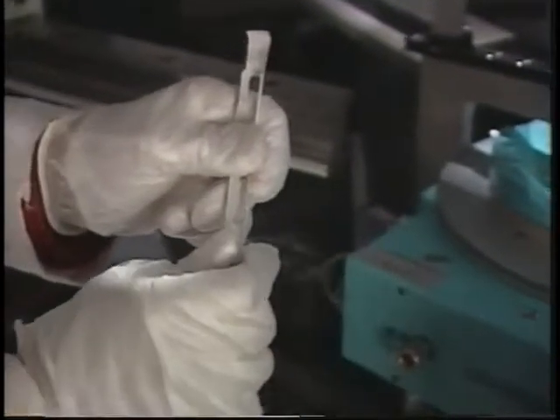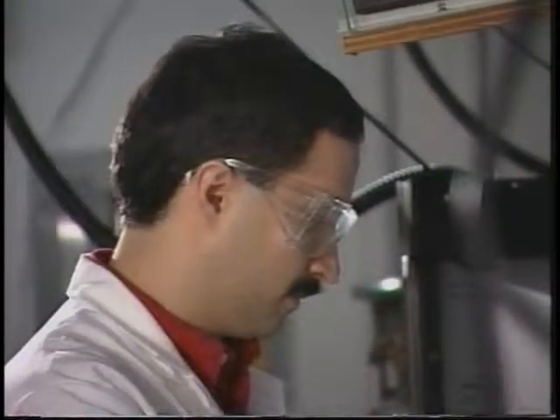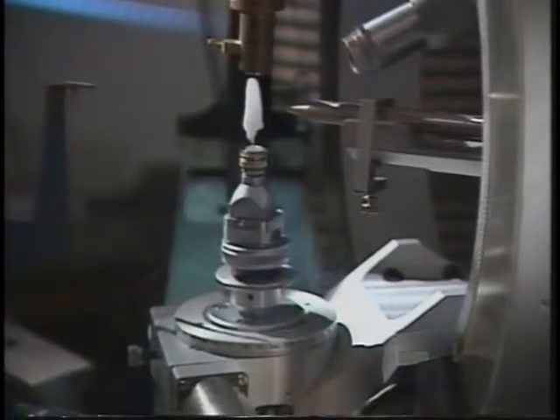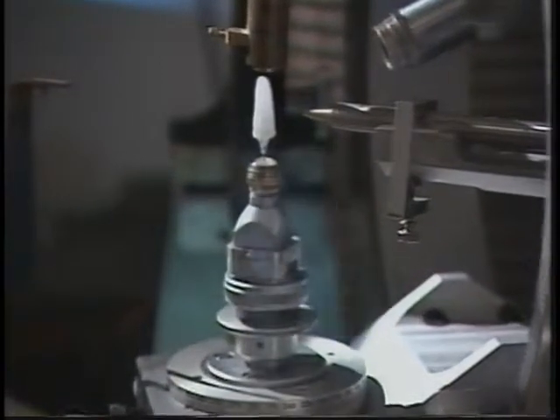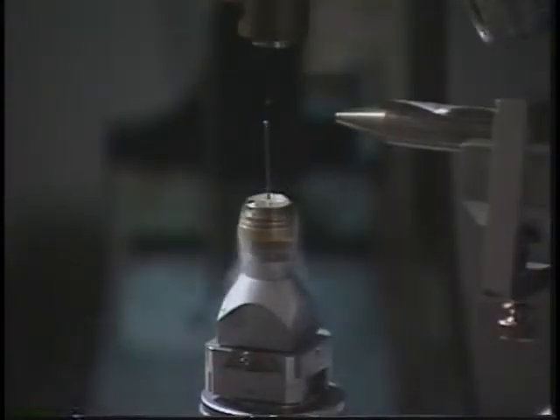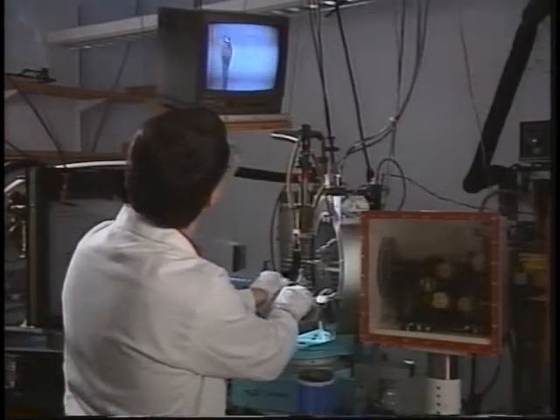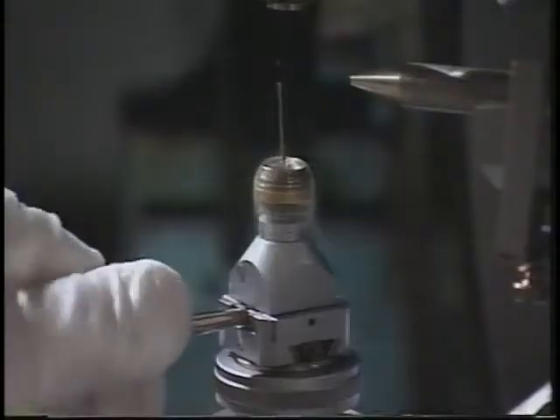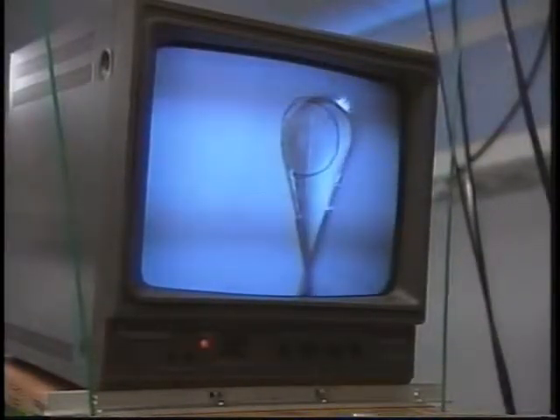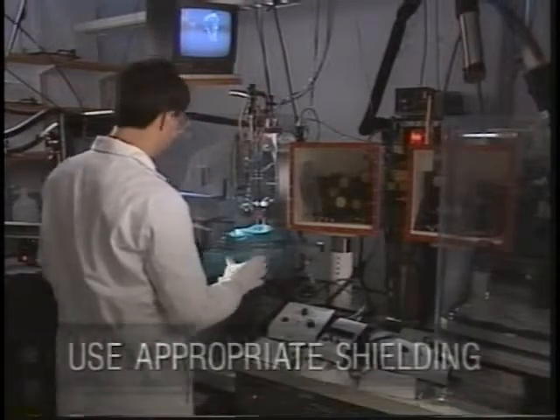He wears cotton gloves under disposable gloves when handling the frozen vial. Yusuf knows that keeping his fingers any length of time in the liquid nitrogen stream could cause frostbite, and he's careful not to get melting propane droplets on his skin while positioning the sample. Yusuf has a keen sense of the beam. He has disciplined himself never to cross its path, even when the shutter is closed. Lead acrylic shields provide protection from scatter radiation.